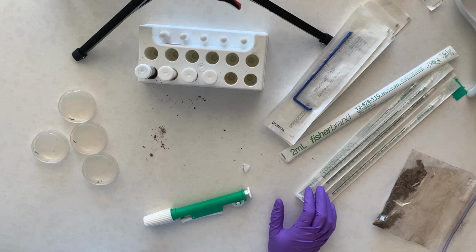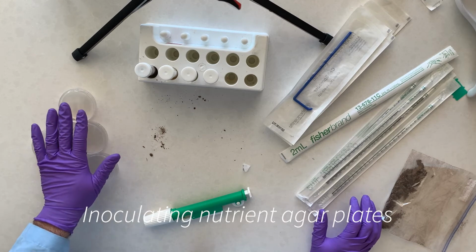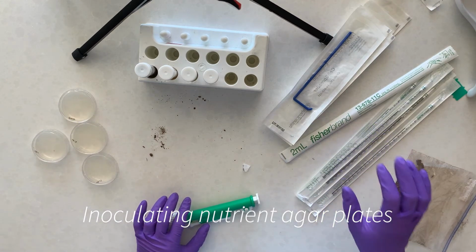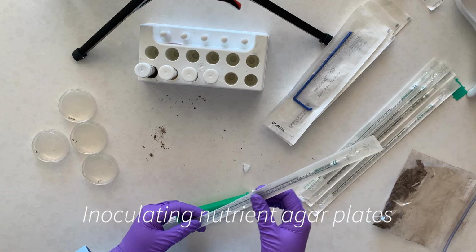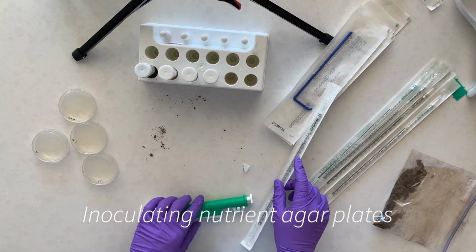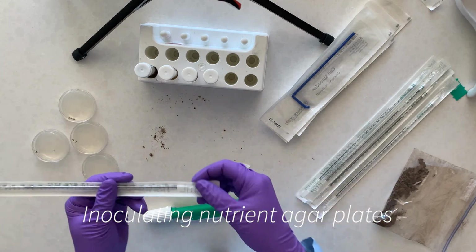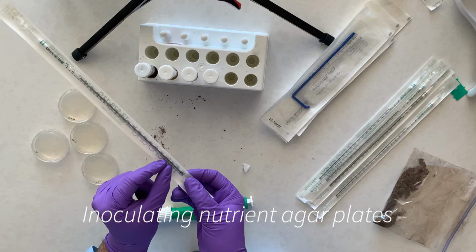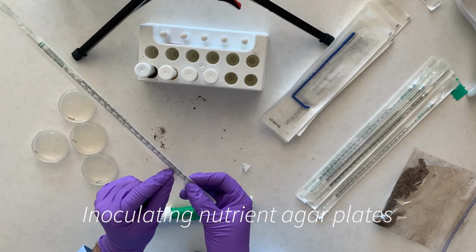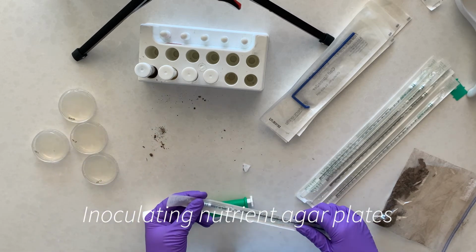So now what we want to do, as we've done in the past, is use these to inoculate our plates. So that's what we're going to do. The same procedure, we've done this in the past, and so we're going to use our transfer pipettes again, or the sterile pipettes, and we're going to transfer not 1 milliliter, but 0.1 milliliter. It's a little hard to see on here, but that's just going to be one of these. It's about 1 centimeter in length. So in the reading, it says about 4 drops of this, and so that's what we're going to do.